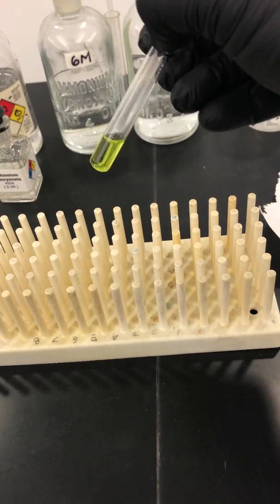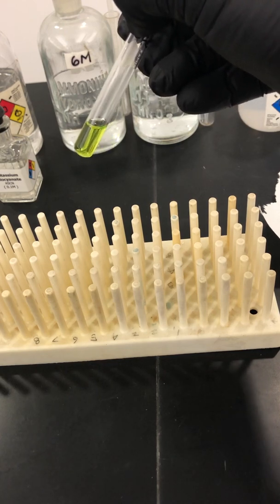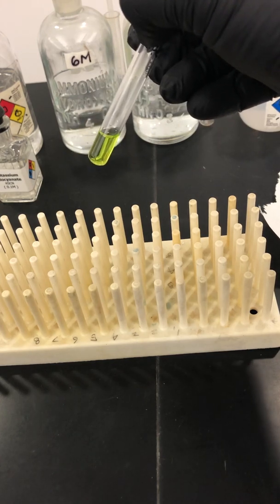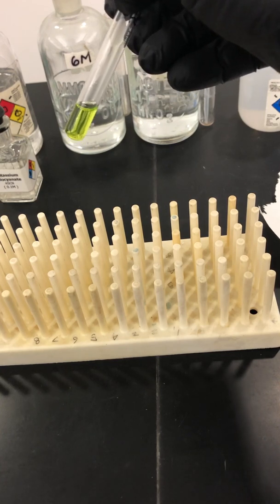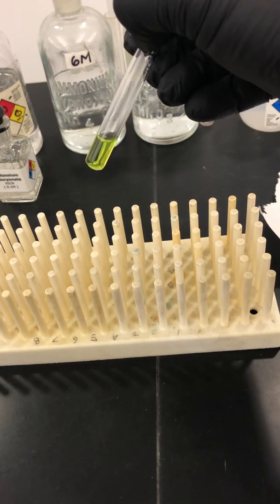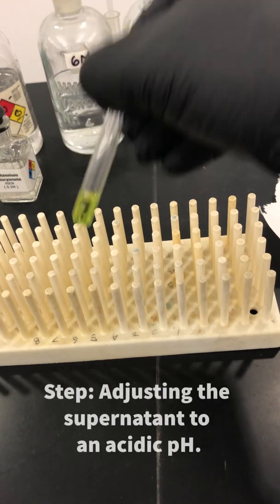Feel free to continue watching the video, but suffice it to say that what I've tried to do here is show you the strategies involved in separating sequentially the cations that might be present in an aqueous mixture. For those of you in Chem 1B, what I'm going to do now is continue the procedure. The main thing now is that in order to selectively precipitate copper II sulfide versus iron III sulfide, I want to make sure that this solution is at an acidic pH around 0.5.